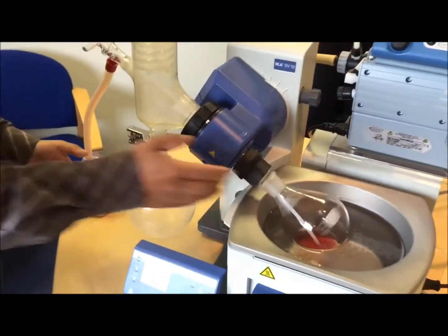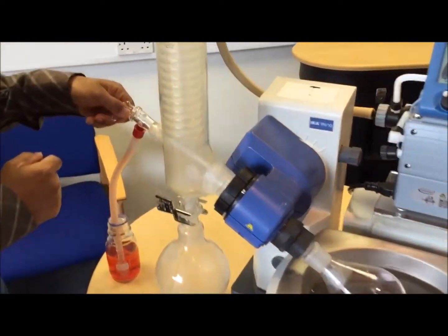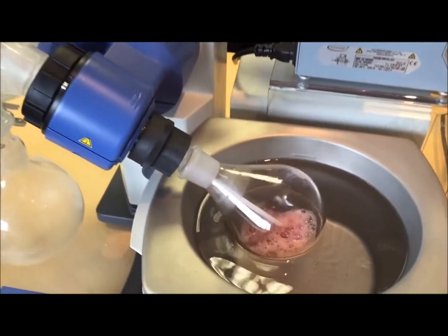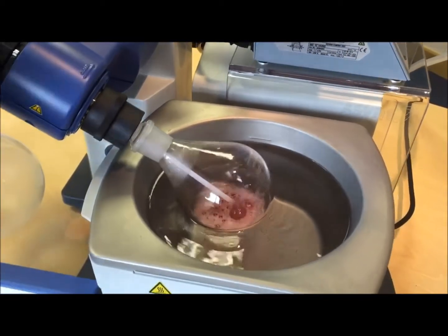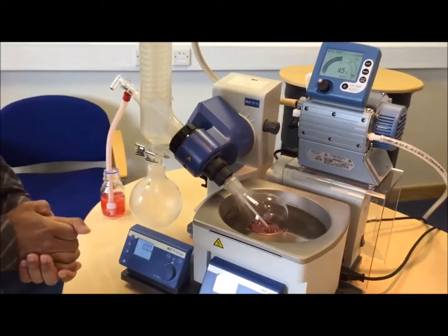As you can see here, we've got a feedstock — we've got material in our evaporation flask. If we just slowly bleed some of this in, you can see that we're going to get a constant addition of our feedstock into our flask.